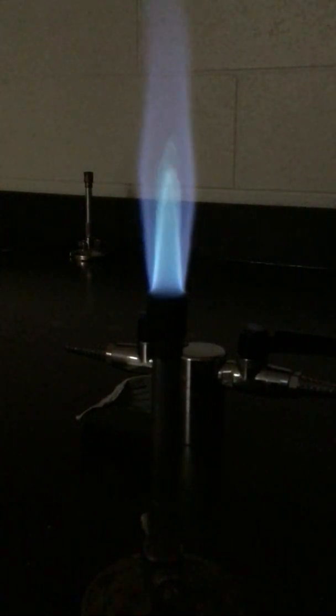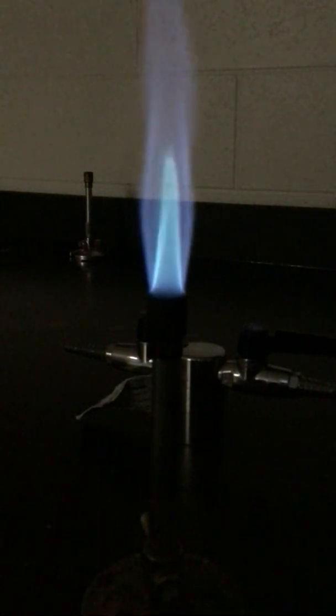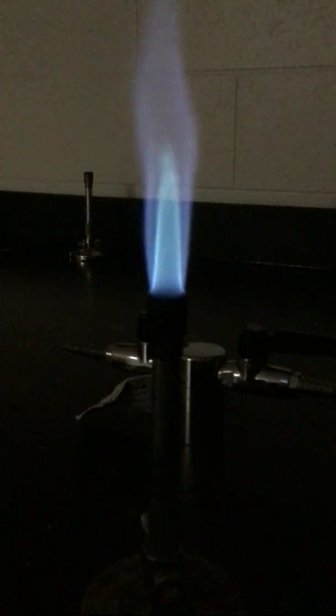Very nice. Now, the last part of the lab is to do an unknown. So I'm going to insert one of these sticks. I'm not going to tell you what it is. I'm not going to give you a number. You're just simply going to say the unknown that I had in the virtual lab is this. I'm going to insert one of these sticks into the flame. Your job in the lab report, and it's only worth 1 point, is to tell me which one it is based on what color it gives off.